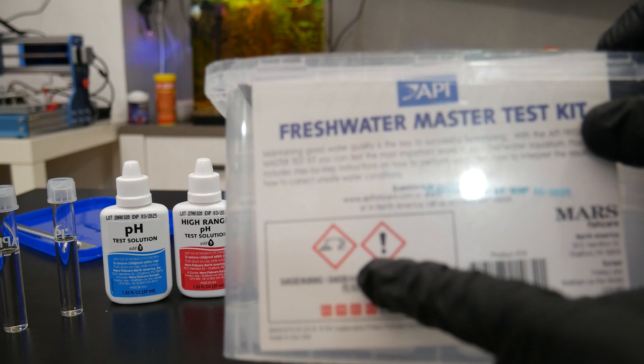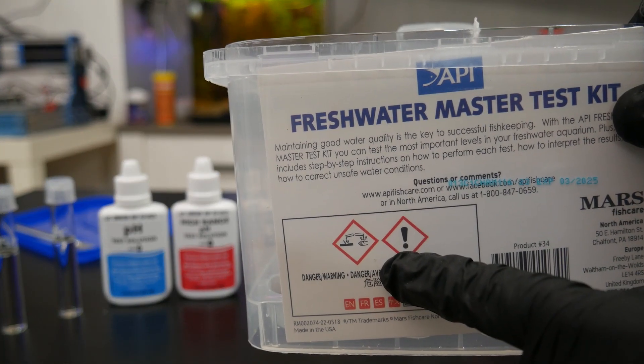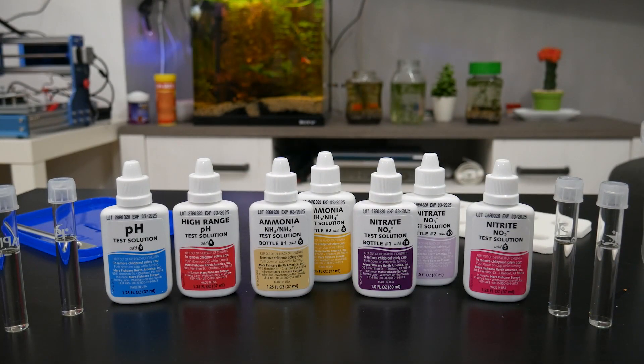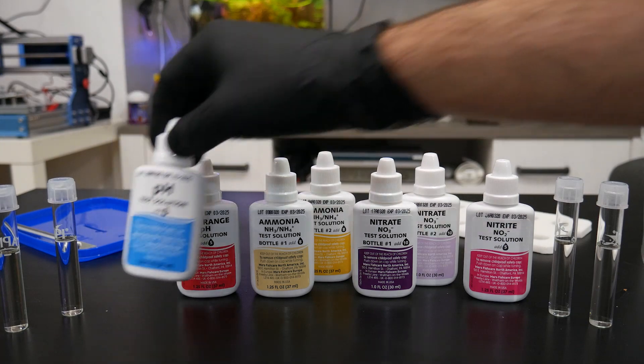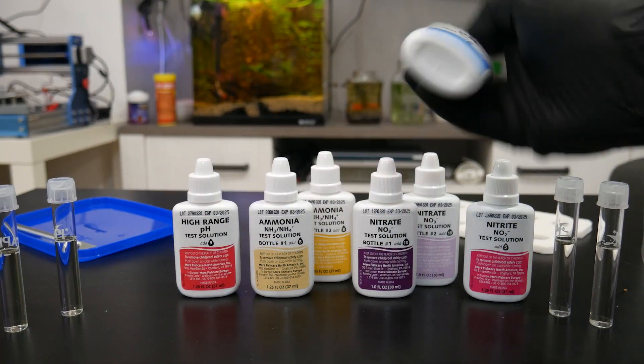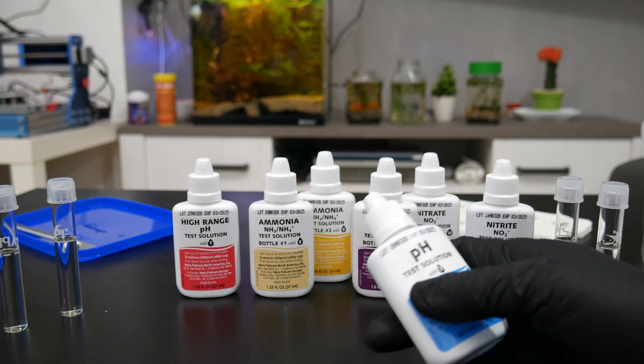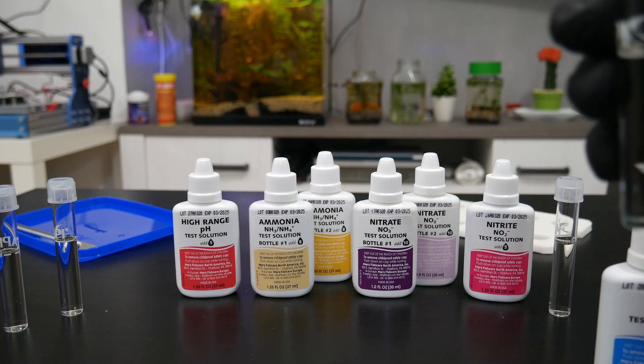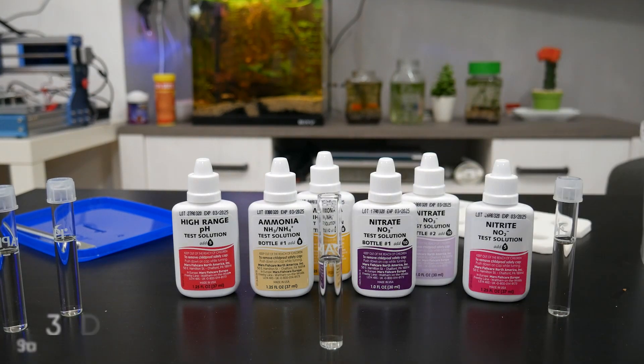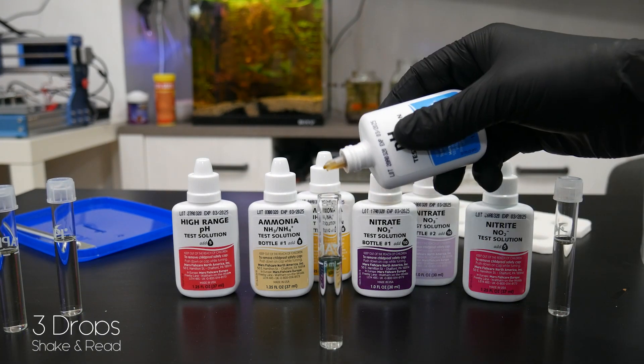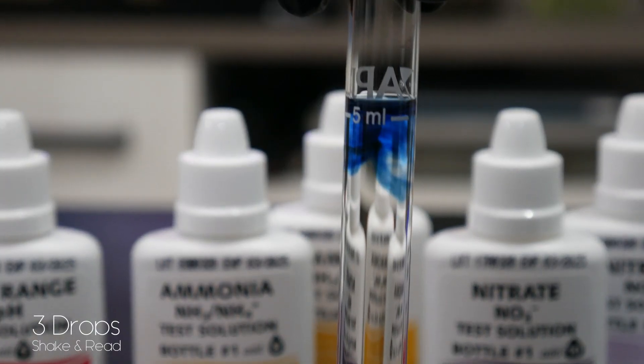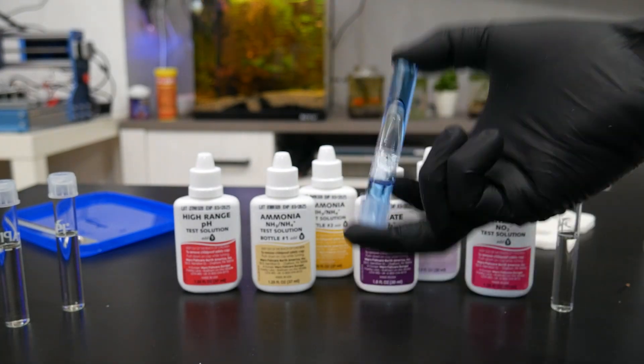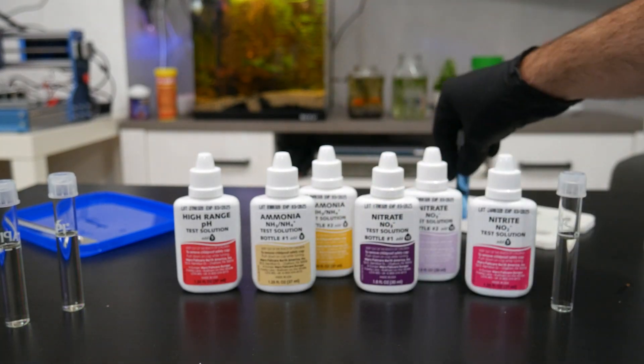Please make sure that you are wearing gloves, those chemicals can be dangerous to the skin. So let's start with the pH test. We need to use three drops from this bottle. We need to shake it a little bit, and it is basically ready for the reading.